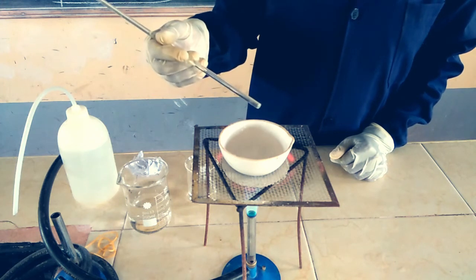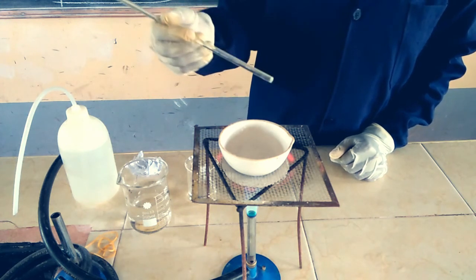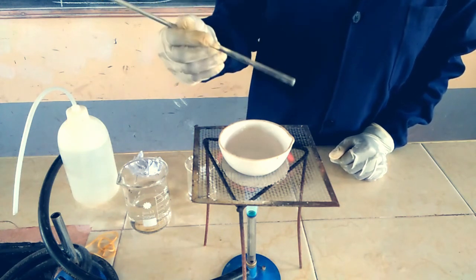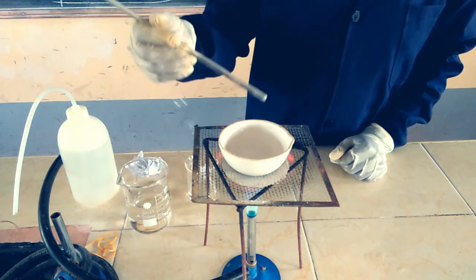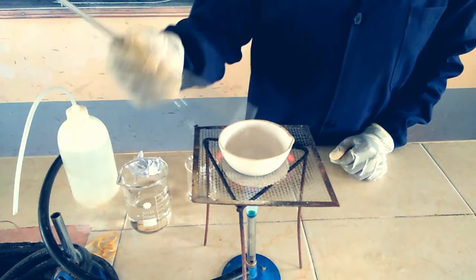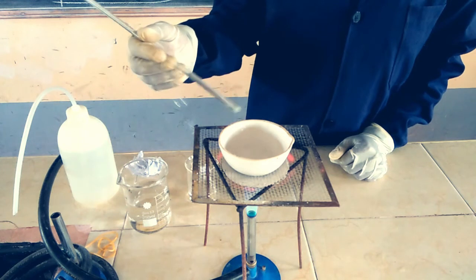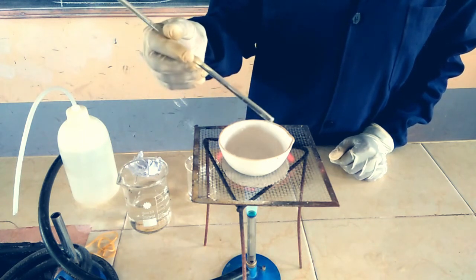Once it starts forming, it means our solution is already saturated and ready to form crystals. However, in this case we're just going to drive out the excess water using evaporation, and we'll use a water bath to avoid the spitting out of the salt during that process.